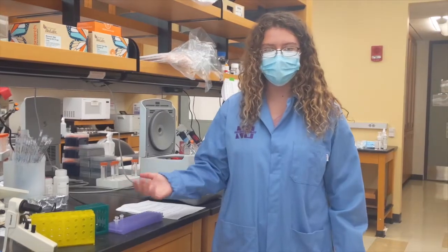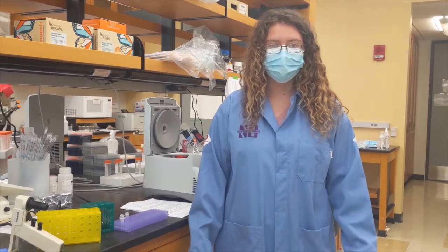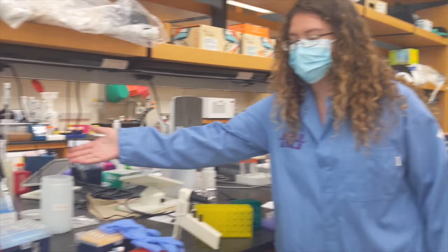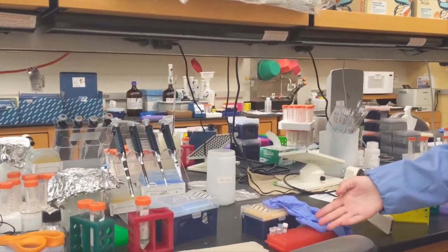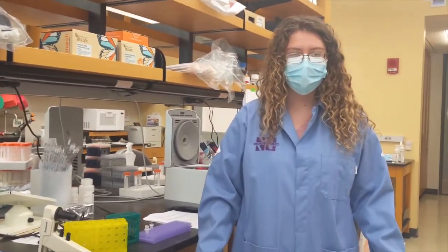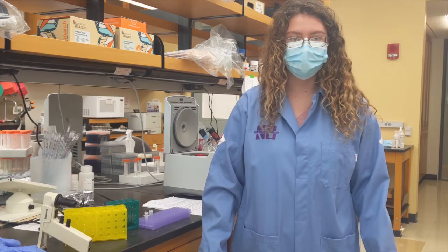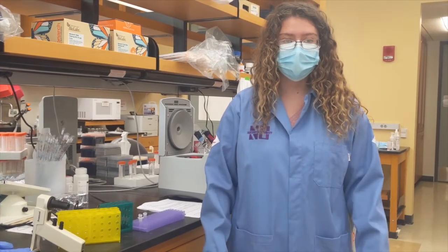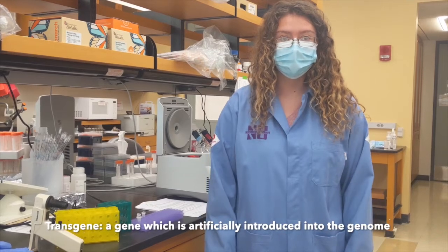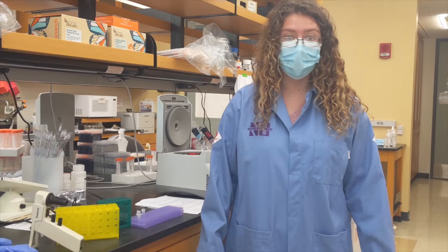This is my lab bench. It is where I perform most of my molecular biology. I work with DNA that is in various types of solutions. I use pipettes like these, as well as tubes like these to hold the DNA. I perform reactions that amplify the DNA, and then ligations that combine different strands of DNA together. This is how I create transgenes that encode for fluorescent proteins. I then inject this DNA into fly embryos to create a new strain of flies.